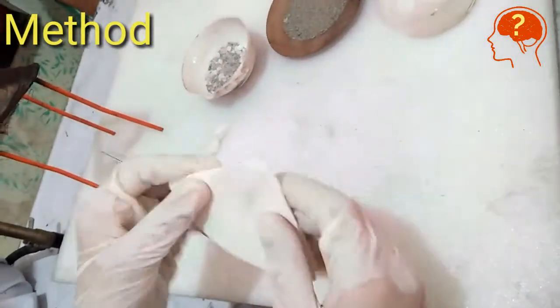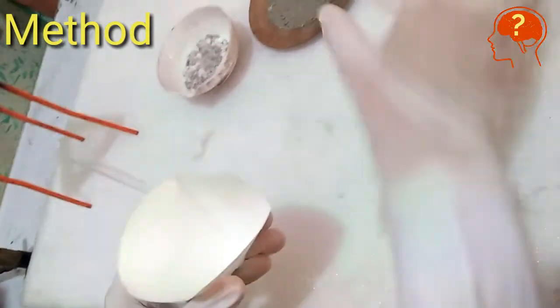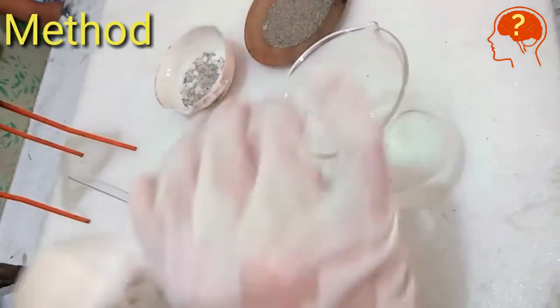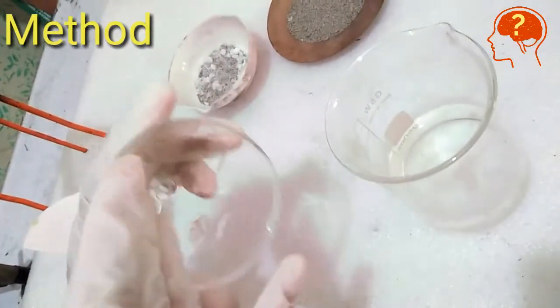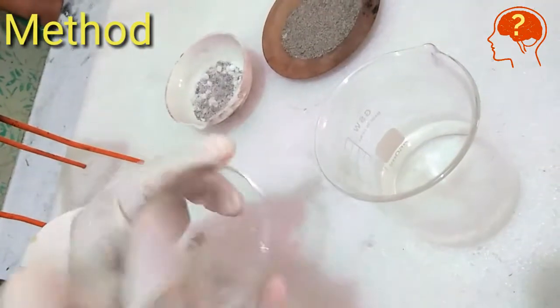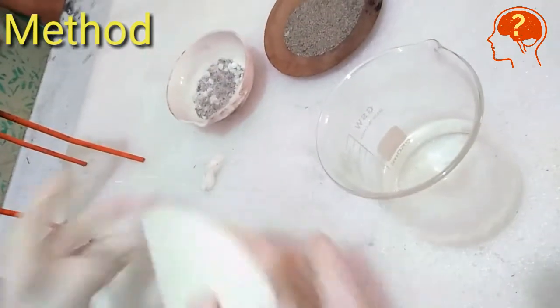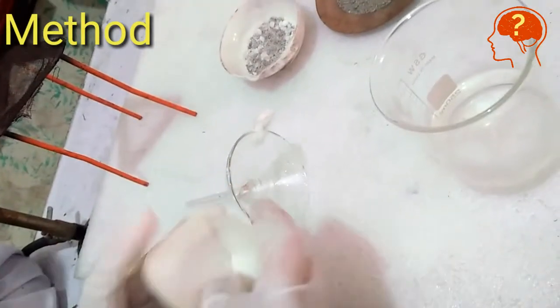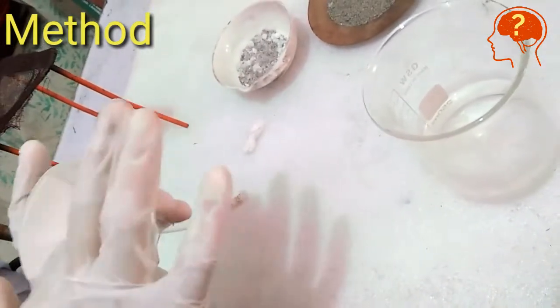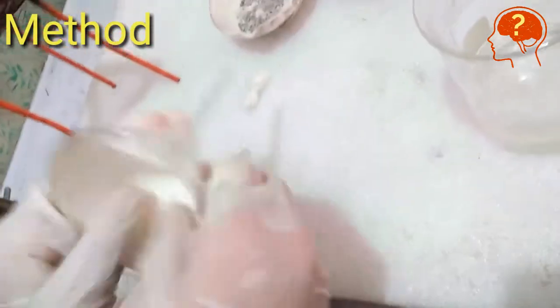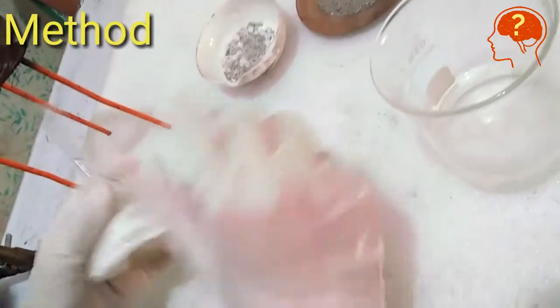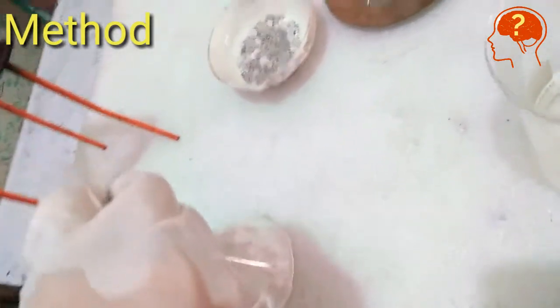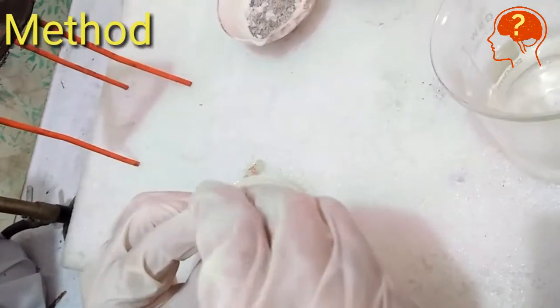Give two folds of filter paper and put three folds at one side and one on the other. Moisten your funnel with water and put the filter paper cone inside the wet funnel. Press the filter paper firmly on the funnel. Now place cotton on the stem top of the funnel.